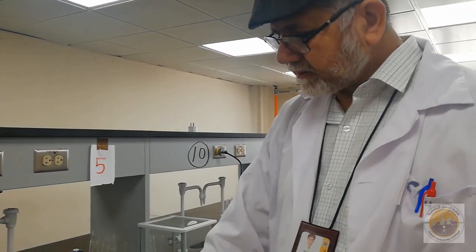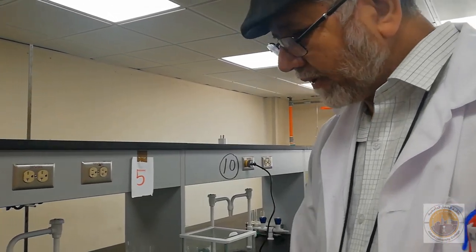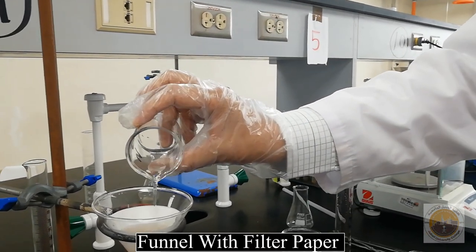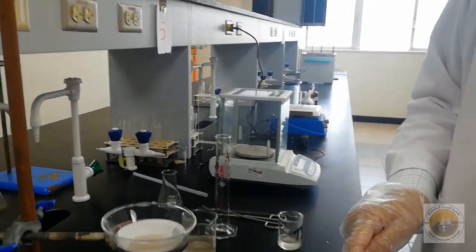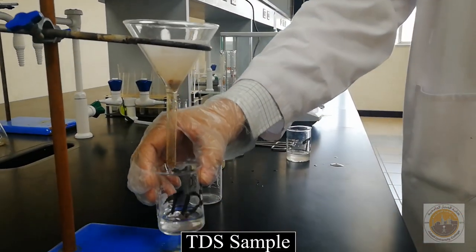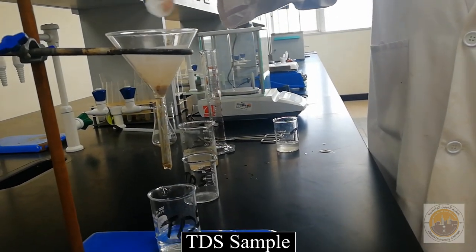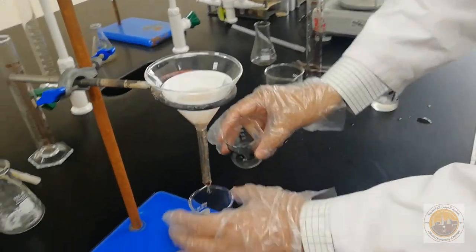This sample is not yet TDS — it is still TS — so we have to filter it. We transfer it into the funnel. There is a white filter paper and the sample passes down through it. This filtrate coming down is the TDS, because the TSS is left over on the filter paper after filtration.